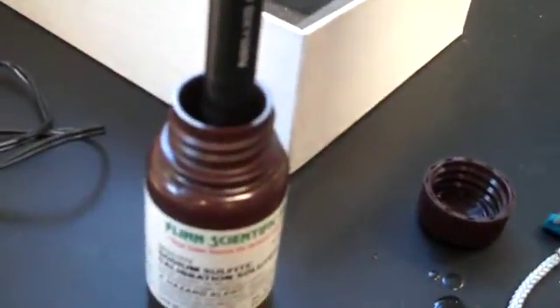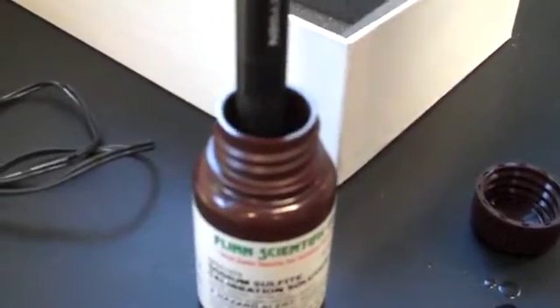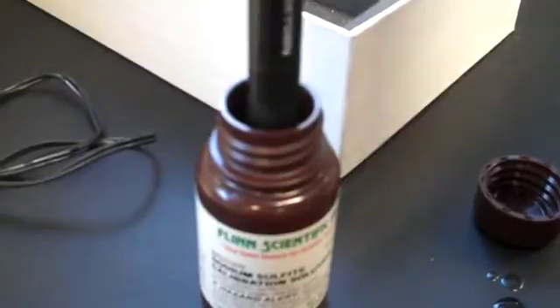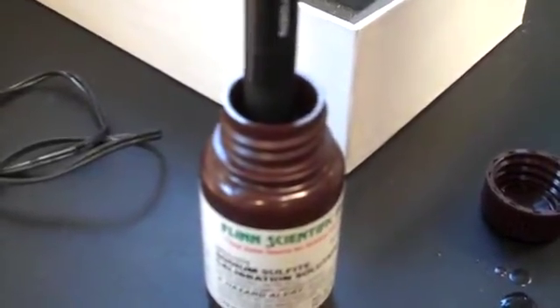So the screen looks like this, and we want to select calibrate now. And then we're going to put the tip of the probe into the sodium sulfite solution — just a little bit down into the solution, just to cover the bottom of the probe. On the screen, you'll see a voltage reading, and you just want to wait until the voltage has stabilized.